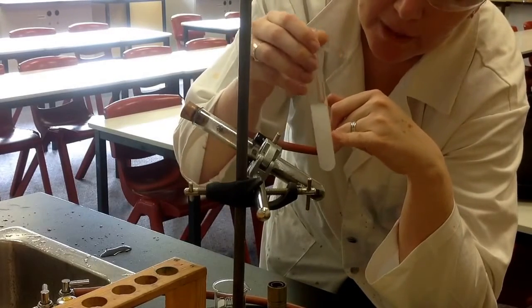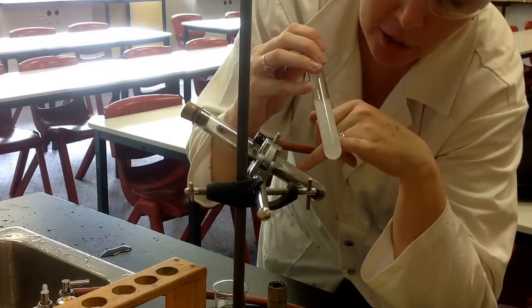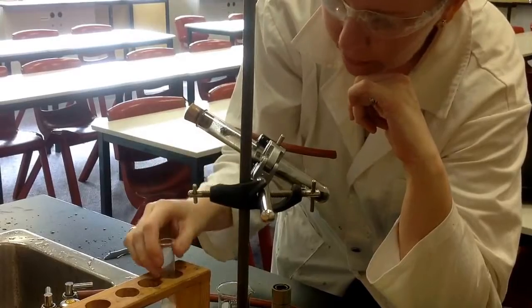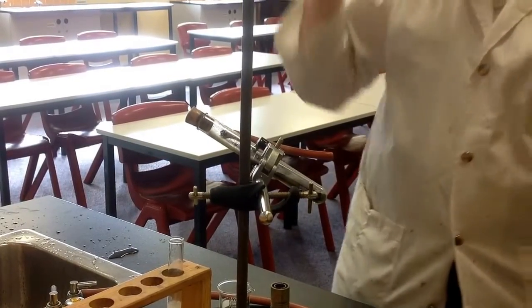So positive tests, we've now formed calcium carbonate in here, which is solid and the rest of it that's left off is water. I'm going to put that aside. And we're going to have a look at another little test you can do in here just for fun.